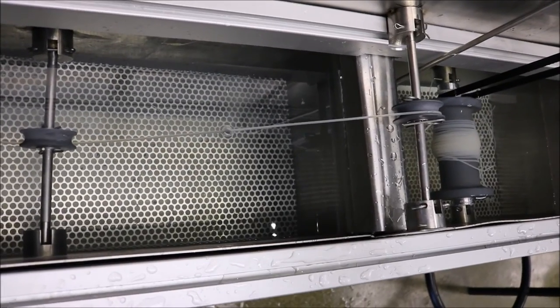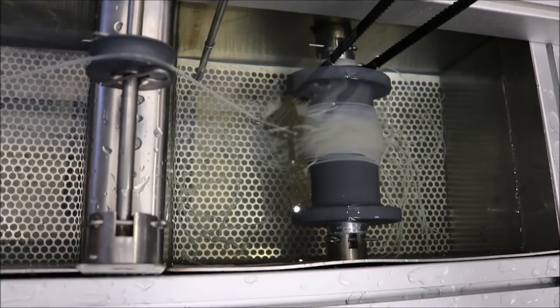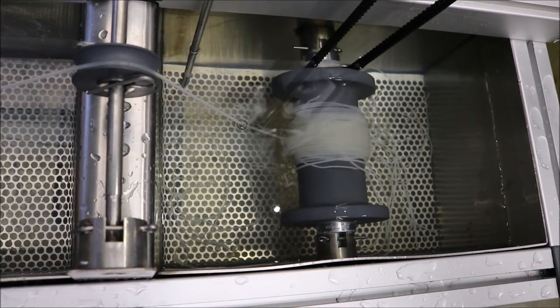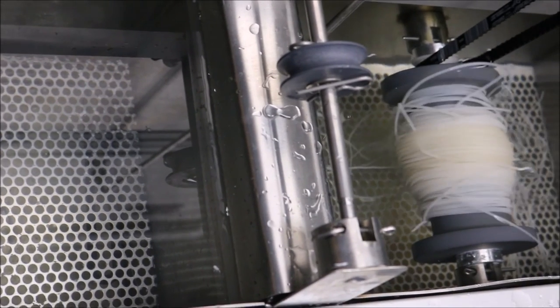The amount of time it takes to complete this operation varies depending on injection speed, run-to length, run-to time, and spool speed. Here you can see our finished spool of hollow fiber membrane product.